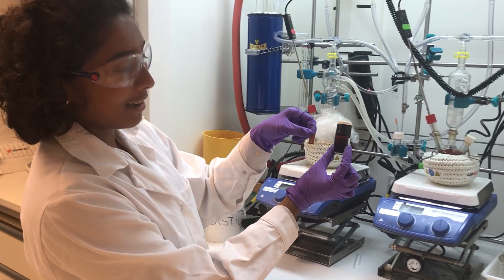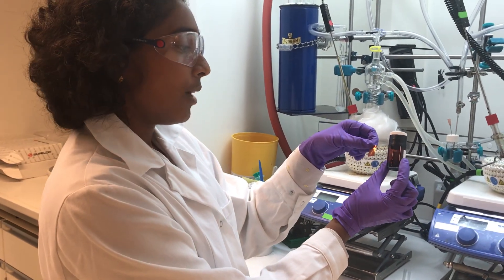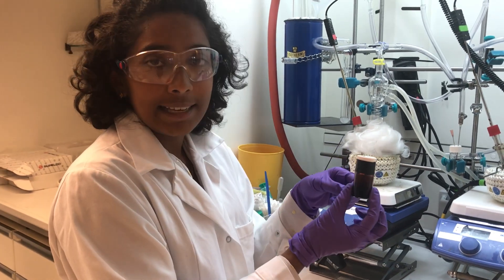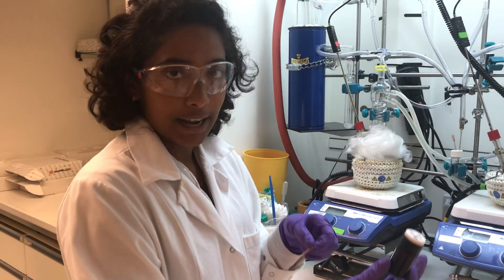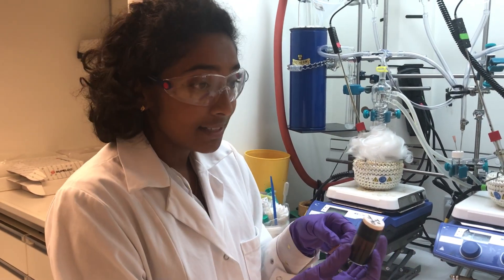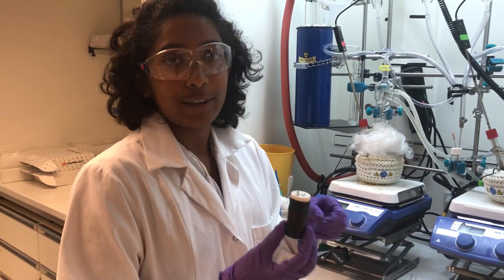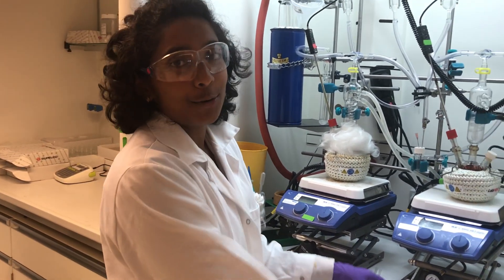As you can see, the color is very different. The properties of these materials change when we go from bulk to nanoparticles, which is why it's very interesting to study these kinds of nanomaterials — which is what we do in our lab.